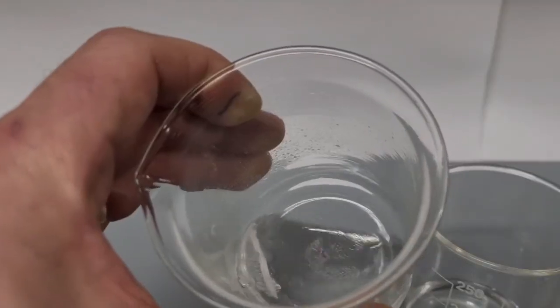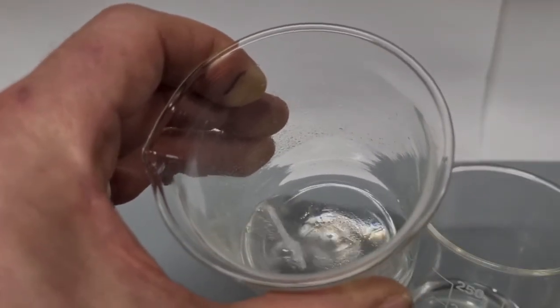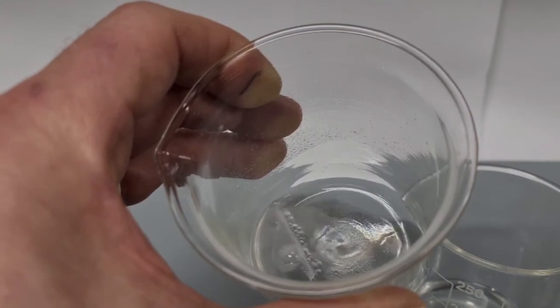Nothing visible will be left behind. A salt magnesium chloride will be left behind in solution.